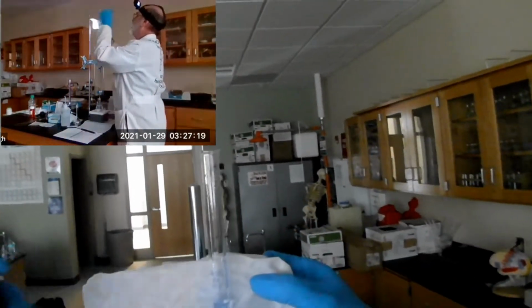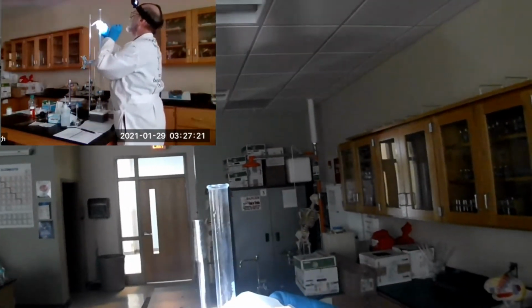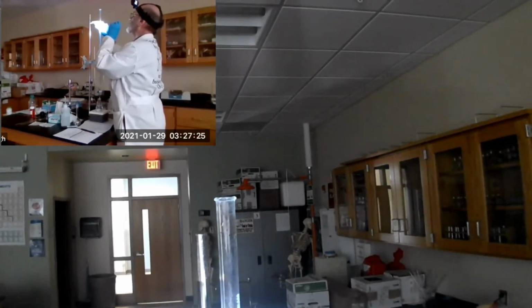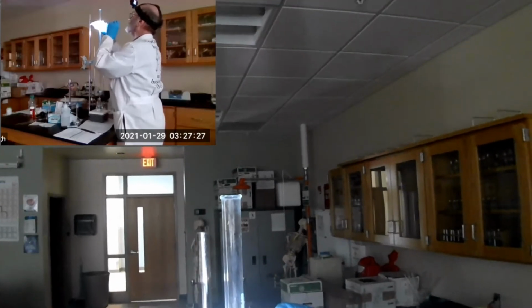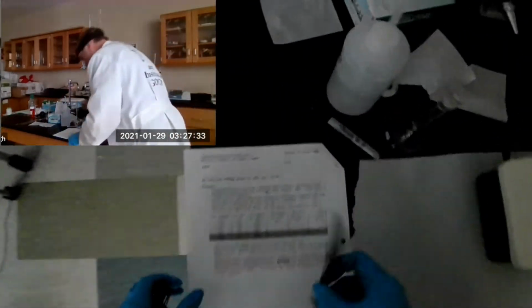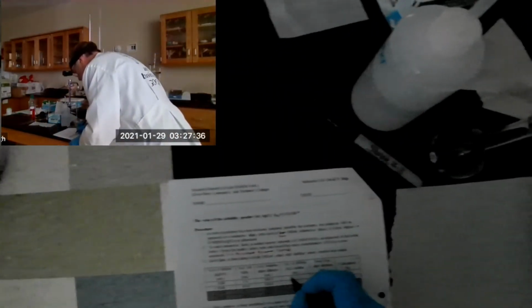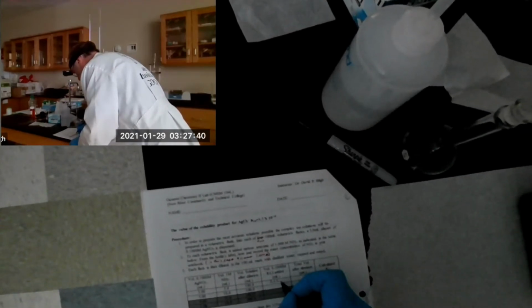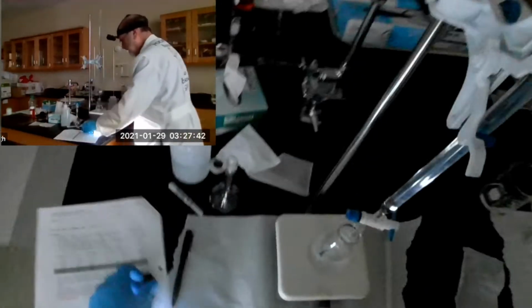There we go. So I see 0.65. Okay, we're going to have to make another solution.